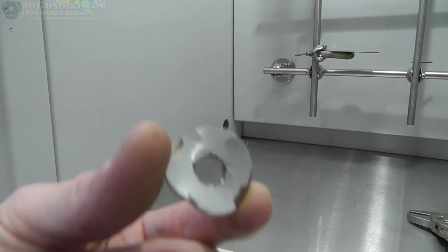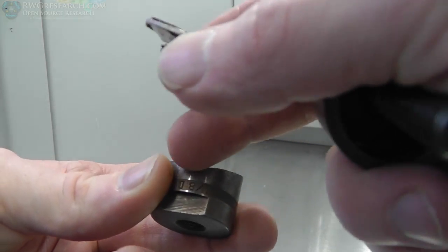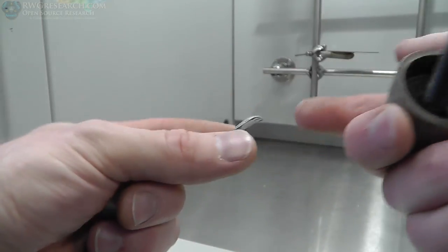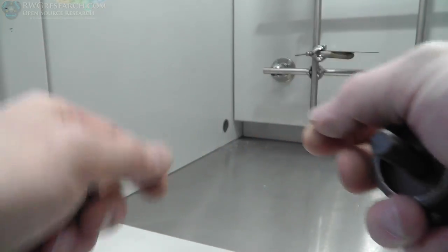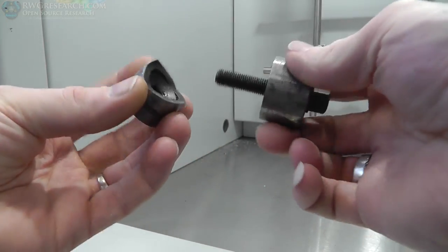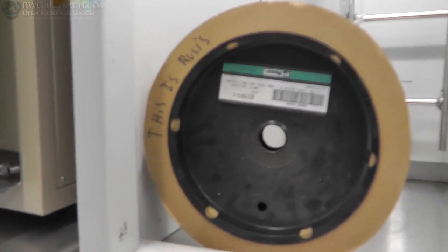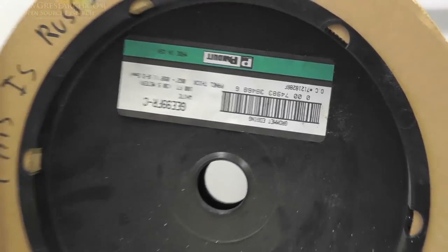Because there's a sharp point where it starts to work its way down, you don't have all that shear in one place to punch a hole. You work from a point and you work your way down. So, got the paint flaking off. Easy as pie. In case you're wondering, I am going to be using this, which is upside down.